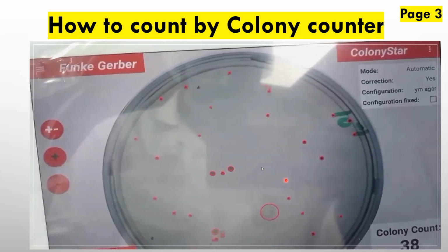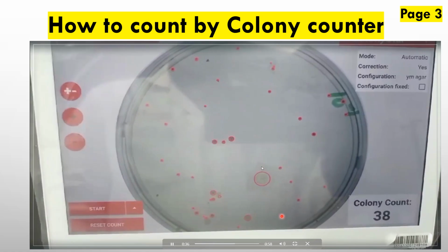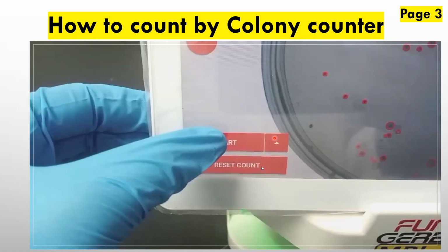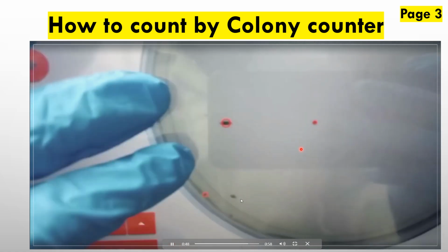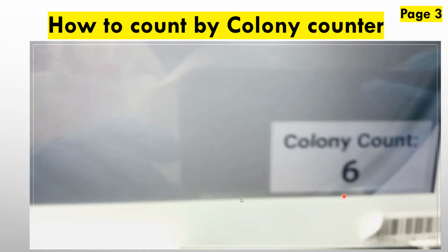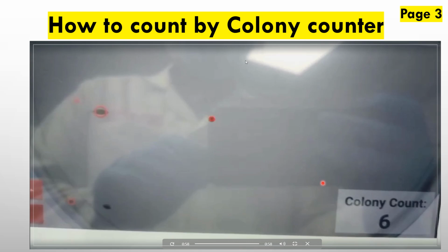This is the first dilution. In the same way, we also go for the second dilution, and we will go on to the next plates. This is the second dilution plate, and we will count in the same way. In the same process, we will count the total number of colonies with the colony counter, and then this is the total number of colonies counted by the colony counter. And in the same way, we will go on to our next formula for total colony count.